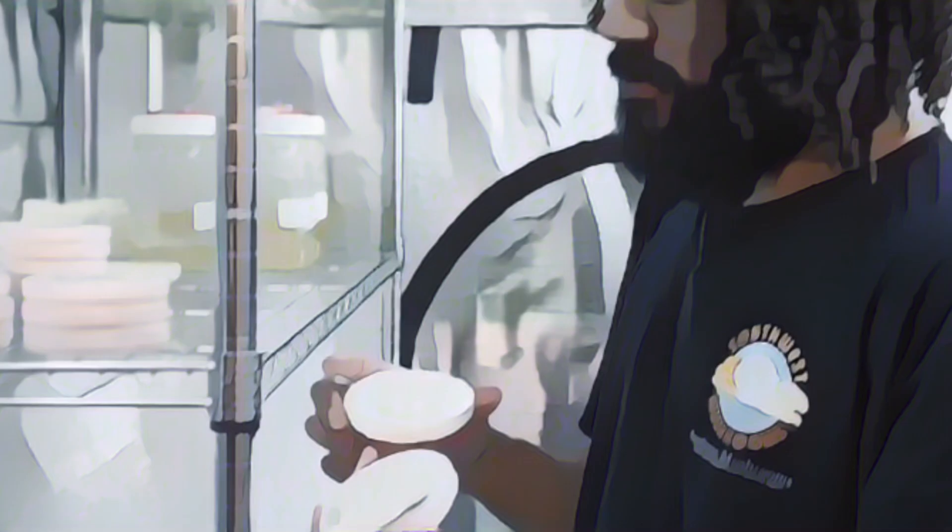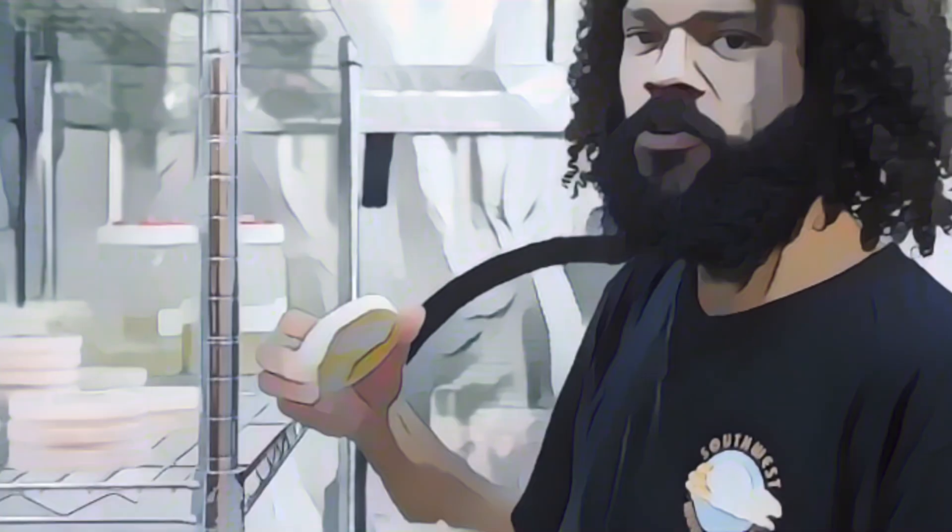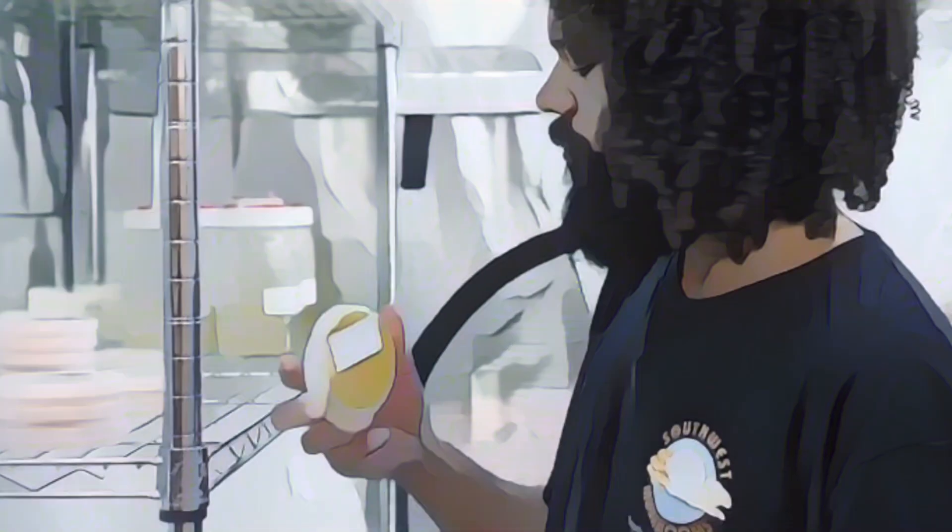I have seven different strains that I've plated out here from some liquid cultures. Today I'll be taking little pieces of tissue from these plates and dropping them into nutrient media broths to basically expand the mycelium.